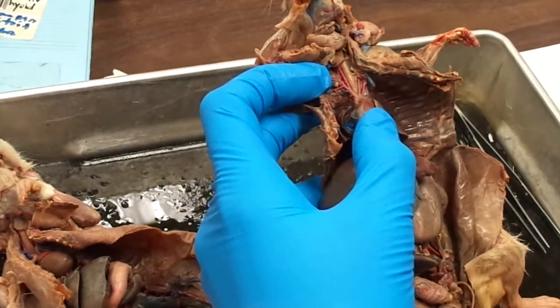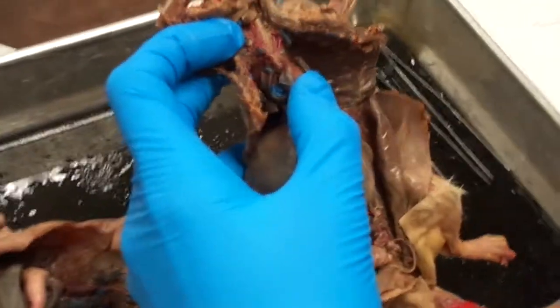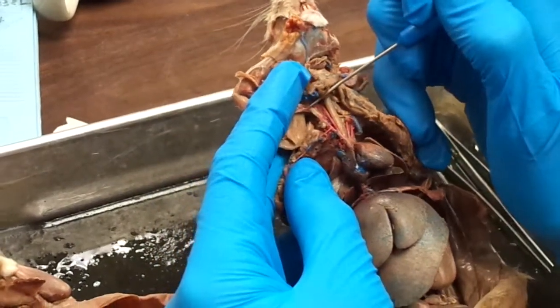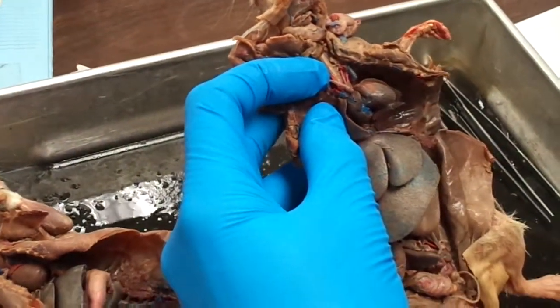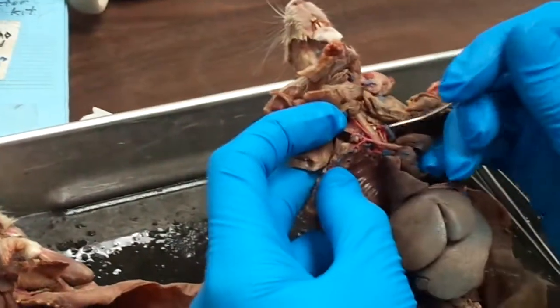The next left segment is going to be the subclavian artery, which has various arteries branching off of it. So after this branch, this is subclavian, coming all the way up to right here, with all these branching off of it. Three are going to branch off pretty quick. You'll have your internal thoracic and your costocervical artery going posterior.